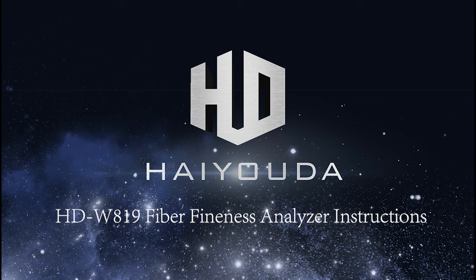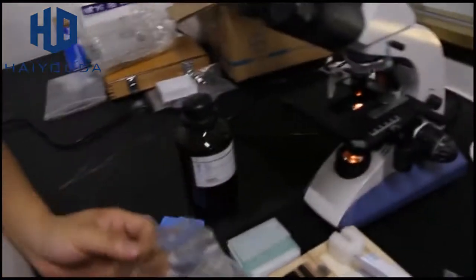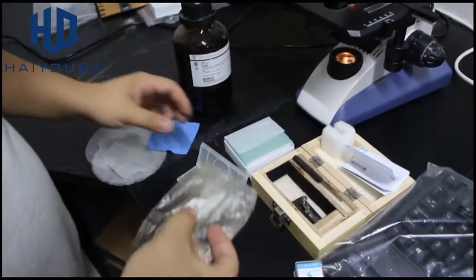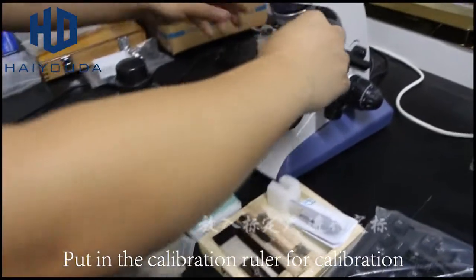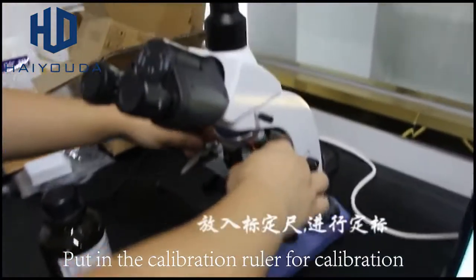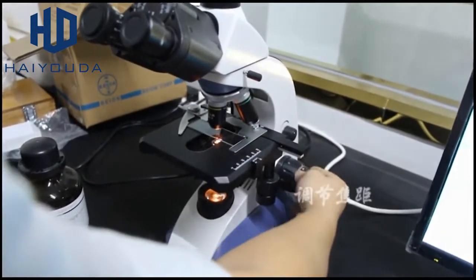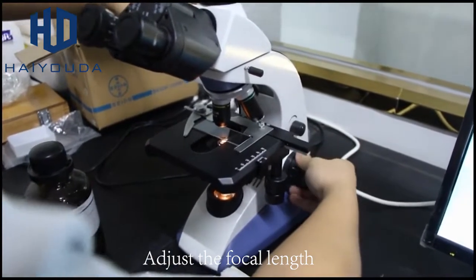HDW819 Fiber Fineness Analyzer instructions. Put in the calibration ruler for calibration. Adjust the focal length.